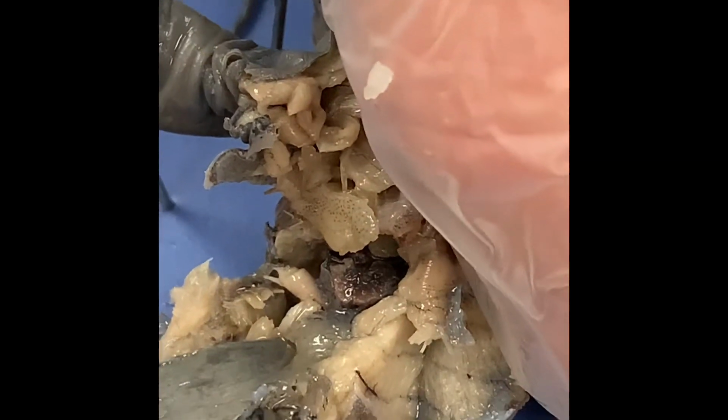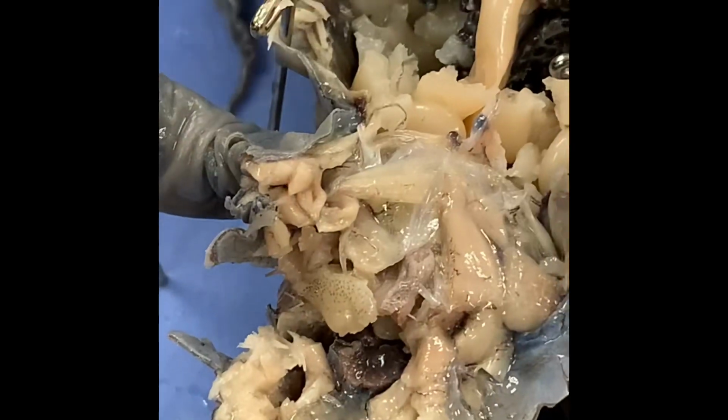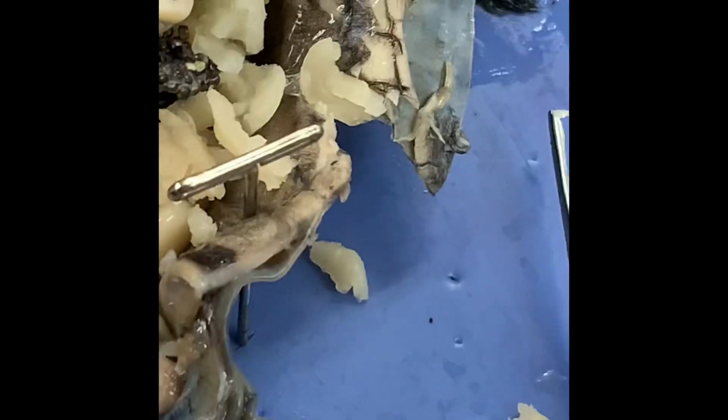I can't. I know. I saw it on the video. Like I could see it a little. There it is. Right there, that little black thing's the kidney. You tell me where the spleen and pancreas is. The spleen and pancreas are gonna be right next here. They're pretty ripped up, anyways.